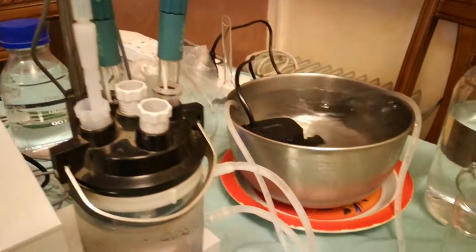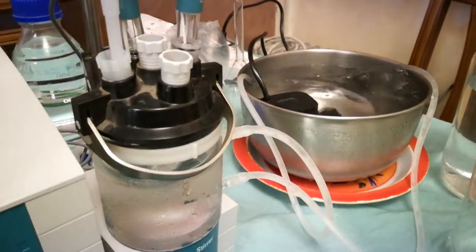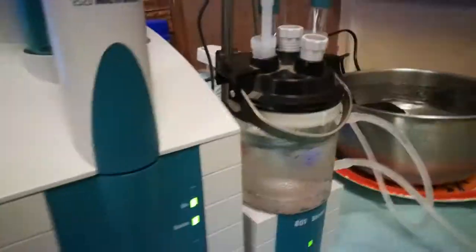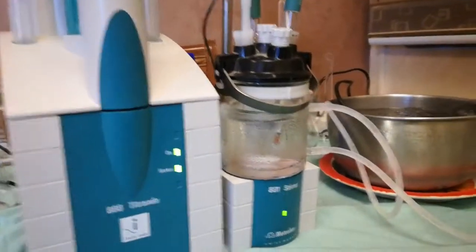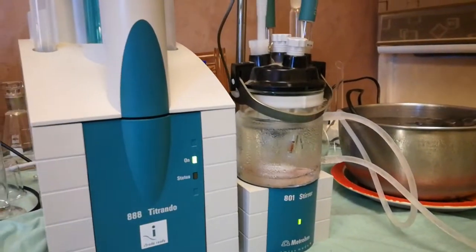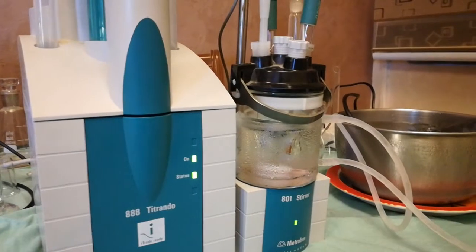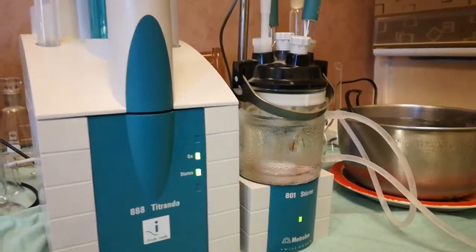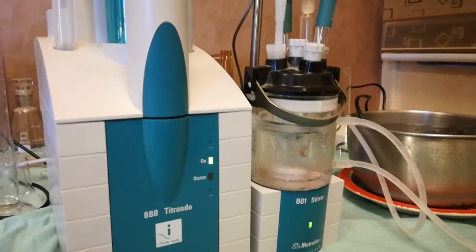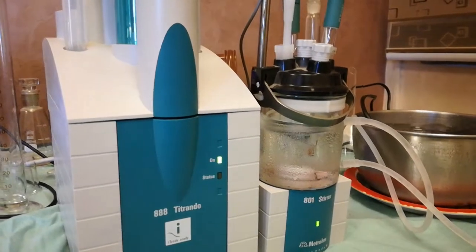The ice bath is very important because the reaction takes place at around 5 to 8 degrees centigrade.